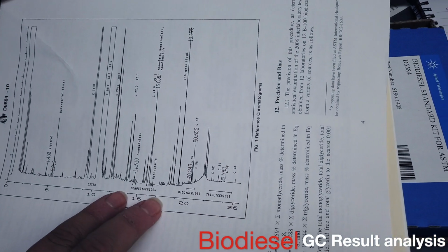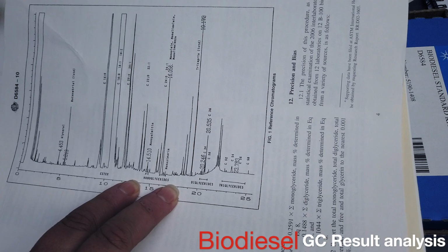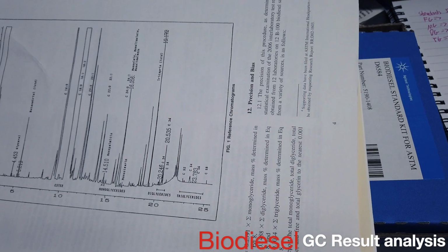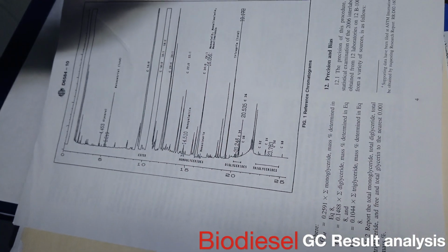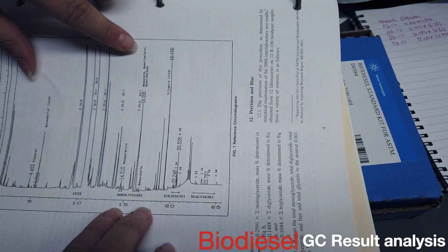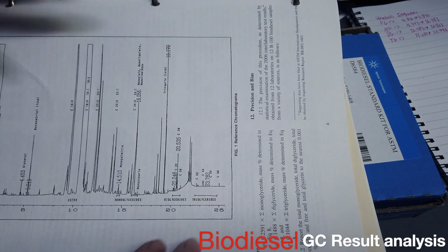All right. So generally in the 14-minute range is where the monoglycerides are. Is that where you're at? 14 something. Well, 14.5 somewhere in that window. 14 to like 17. So here's 14.5, 15, 16, 17. So that window there is where the monoglycerides would be. And then the diglycerides are going to be somewhere around the 20 range, and the triglycerides are going to be somewhere around the 23 range.